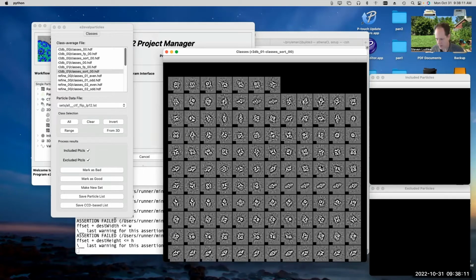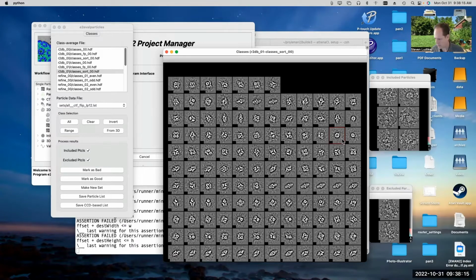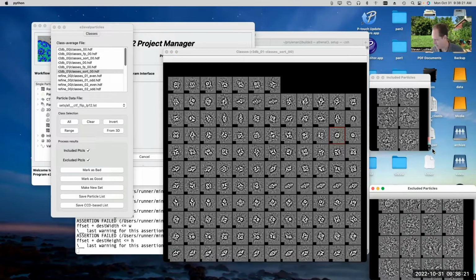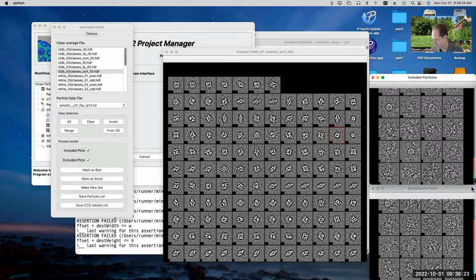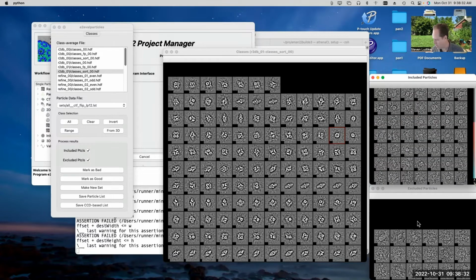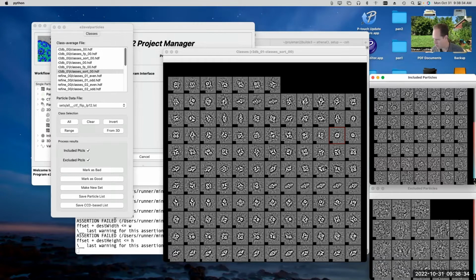So here again are our class averages, and if I say, okay, well, I didn't like the particles in this class average, I can... sorry, and again, it resizes the windows the first time it displays them. It's an annoyance, but anyway. If I single click on it, it will show me the included particles. In other words, the particles it thought were good in the class average, and the excluded particles, the particles which weren't included when it generated the class average. If I double click, it'll put a little blue mark up in the corner.